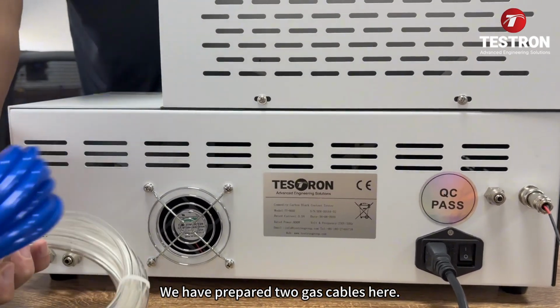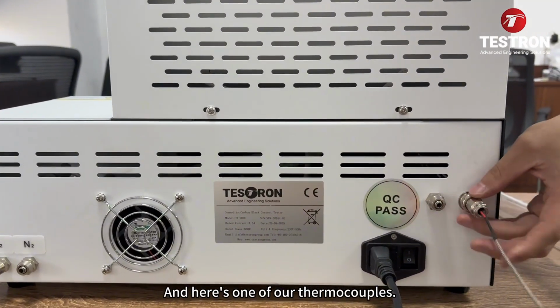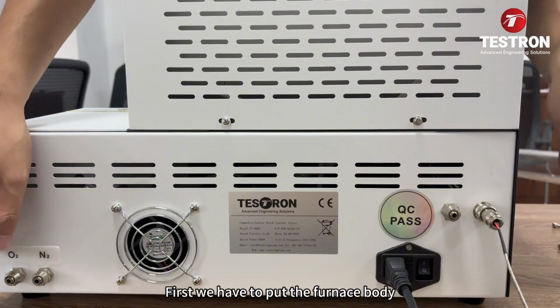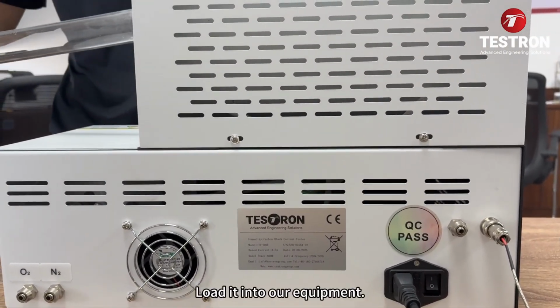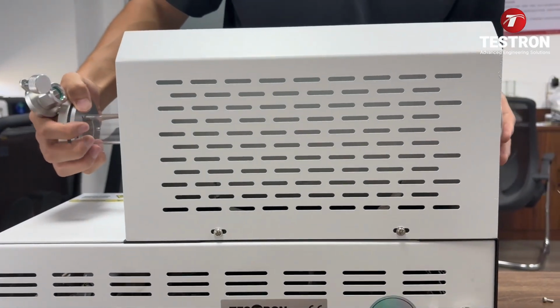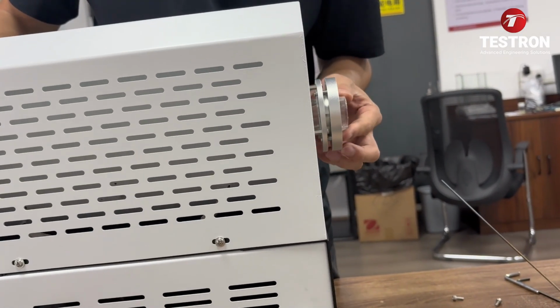We have prepared 2 gas cables here. And here's one of our thermocouples. On the right is intake, and on the left is outlet. First, we have to load the furnace body into our equipment. We need to leave about 8 millimeters on this end.